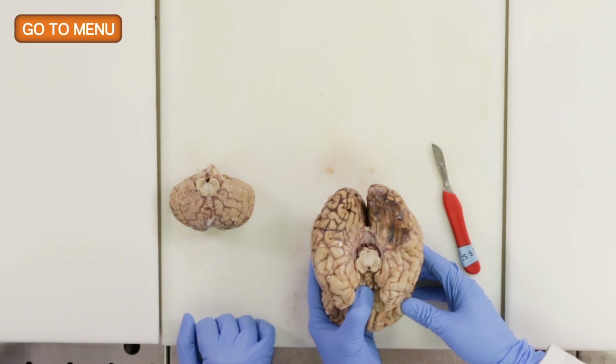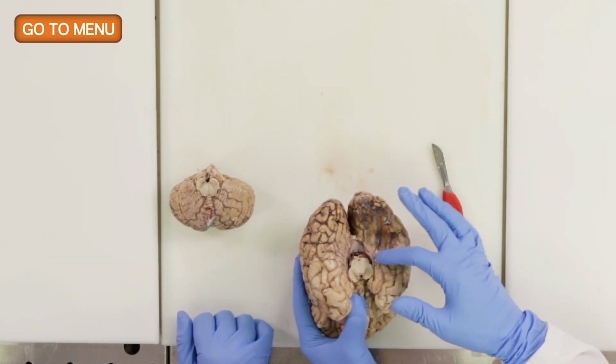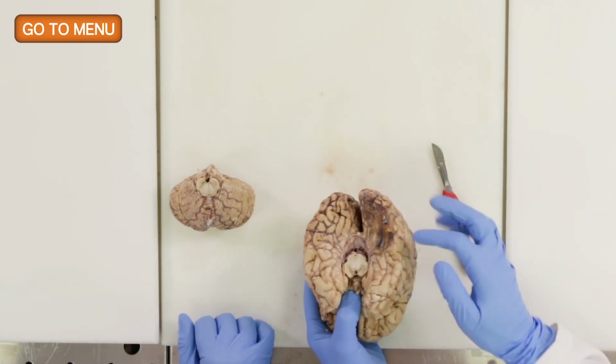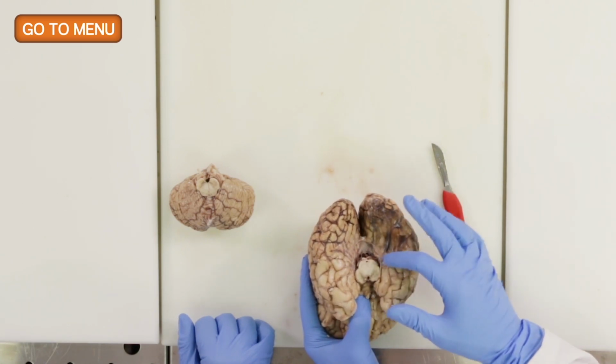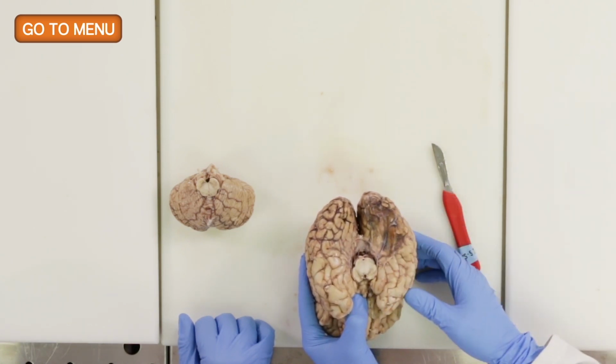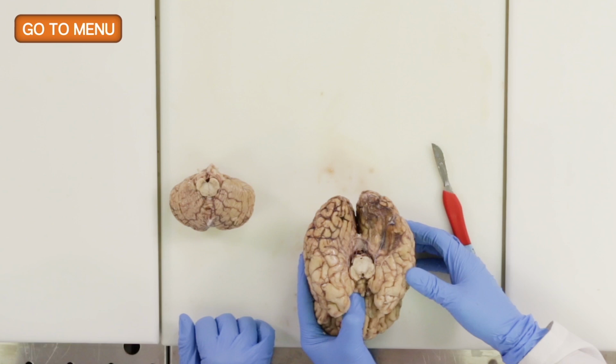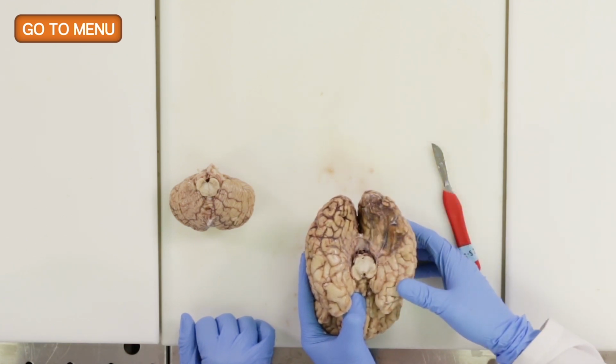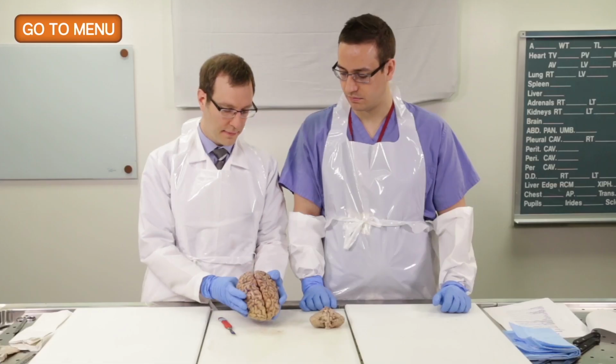is abnormal. That's right. So we can see actually a large area here where the brain parenchyma looks a lot different from this side. And just externally, you can see that there's some cavitation here. There's loss of the definition of the gyri. So this actually looks like it's also potentially involved by chronic infarction.